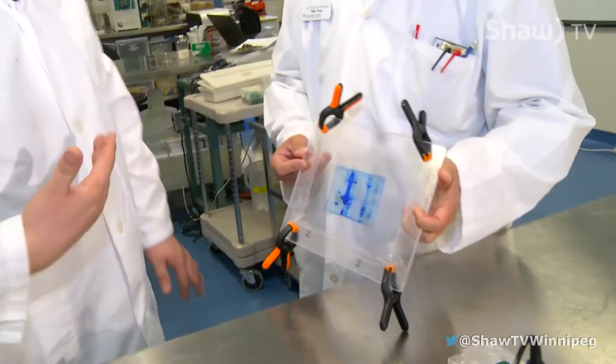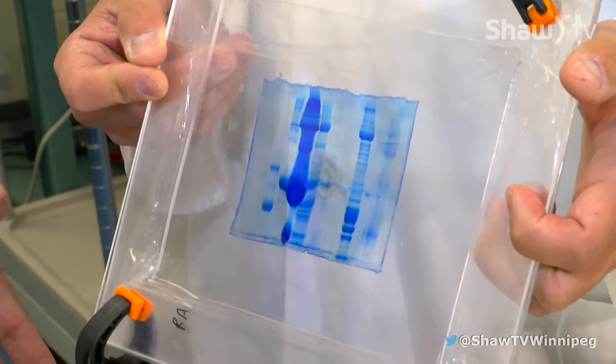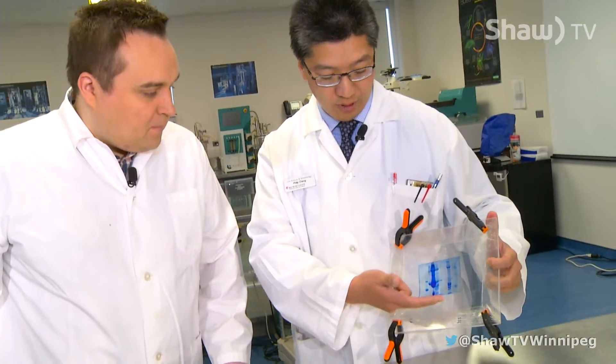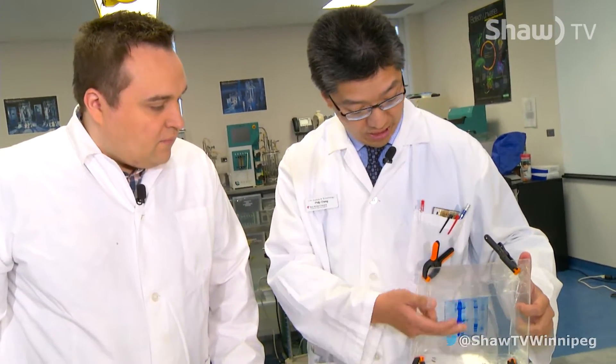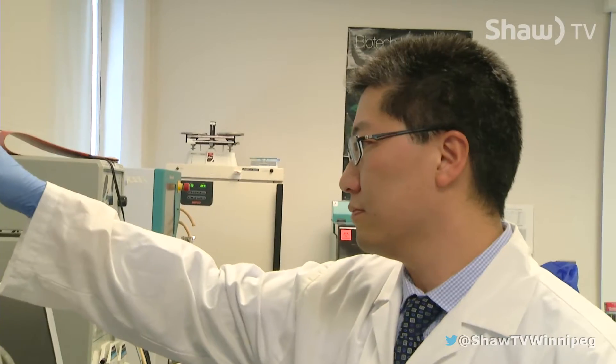In the industry, we need to find out exactly what is in the product that we're making. It takes a little bit of time, and then you end up with this. What you're seeing is separation of proteins actually present in the sample — for example, this particular lane here represents a fish sample.